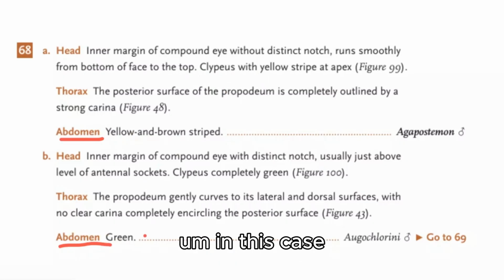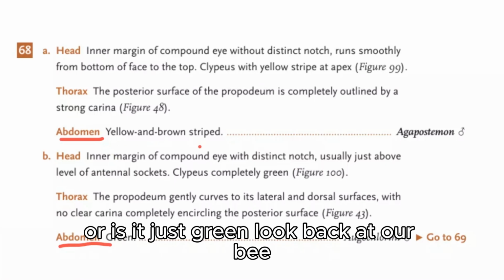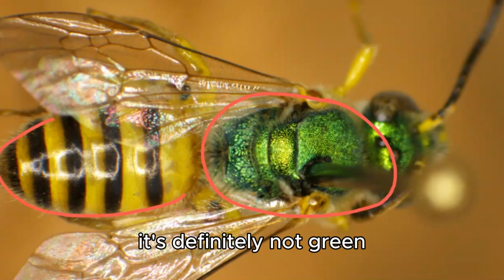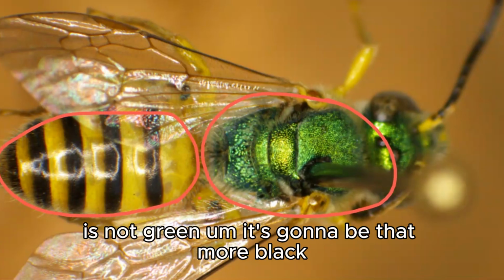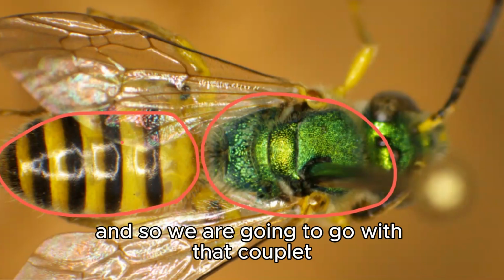And so in this case, it's asking, is the abdomen yellow and brown striped, or is it just green? We'll look back at our bee right here, and we can see that the abdomen is definitely not green. This is the thorax, so the thorax is green, but the abdomen is not green. It's going to be that yellow and brown striped. And so we are going to go with that couplet.